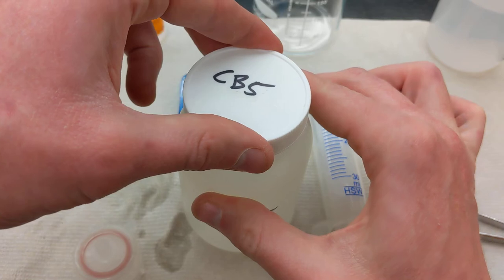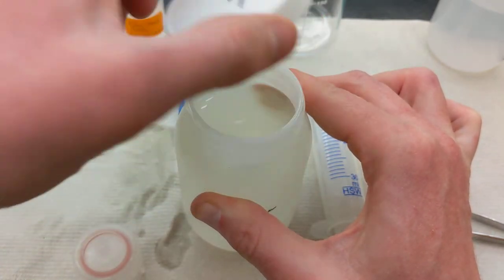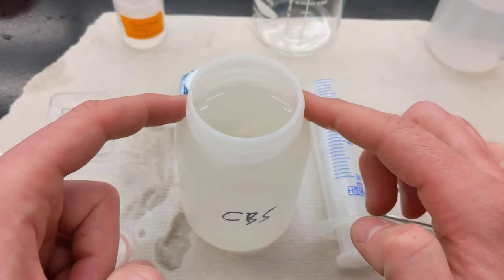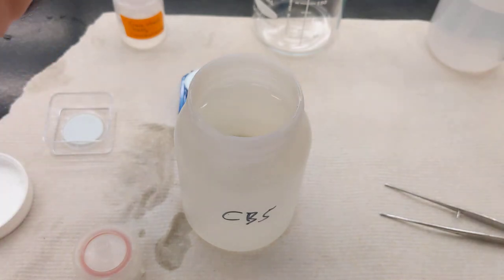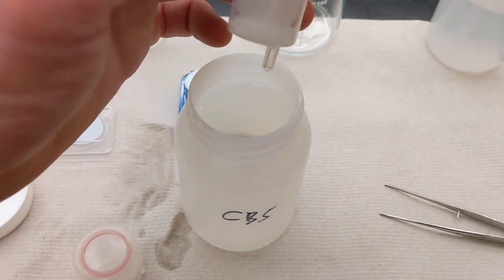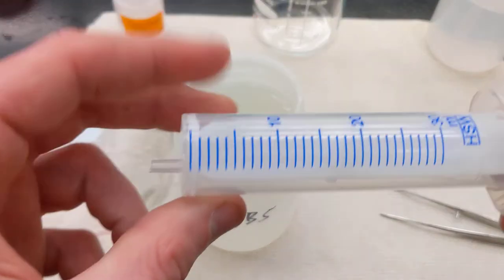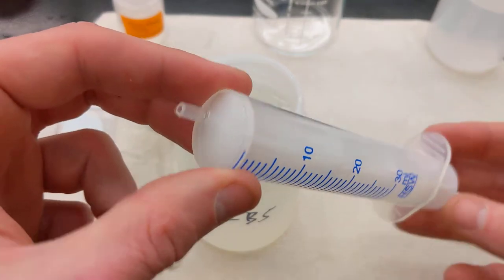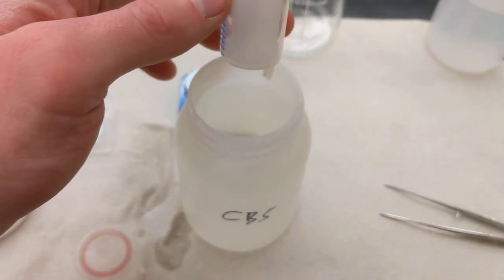To filter this, if you're doing this in the lab rather than in the field, then you've already collected your sample. This has been refrigerated at 4C. It was collected this afternoon. I'm going to take this. This has already been triple DI rinsed, so we can assume this is clean and dry.